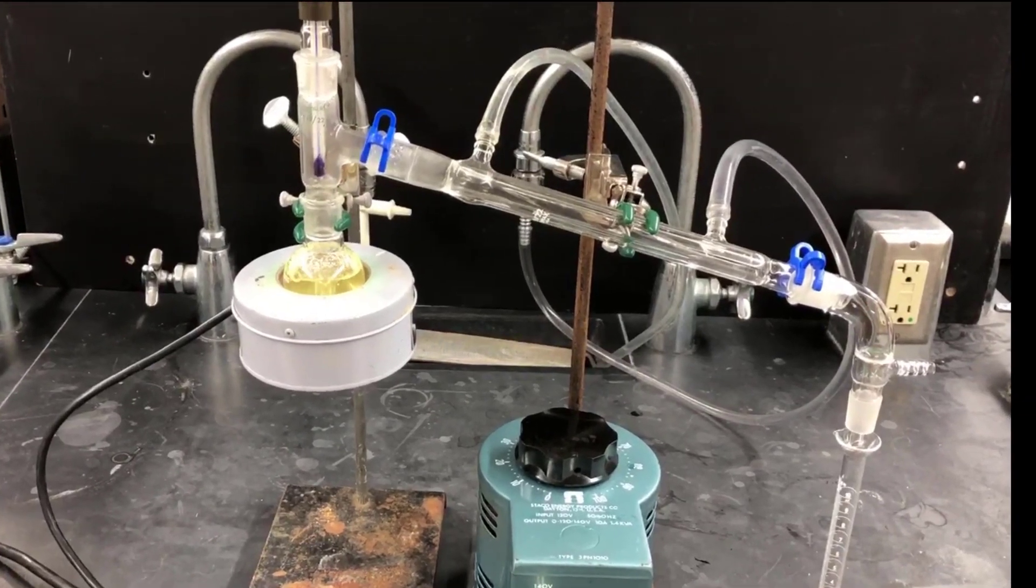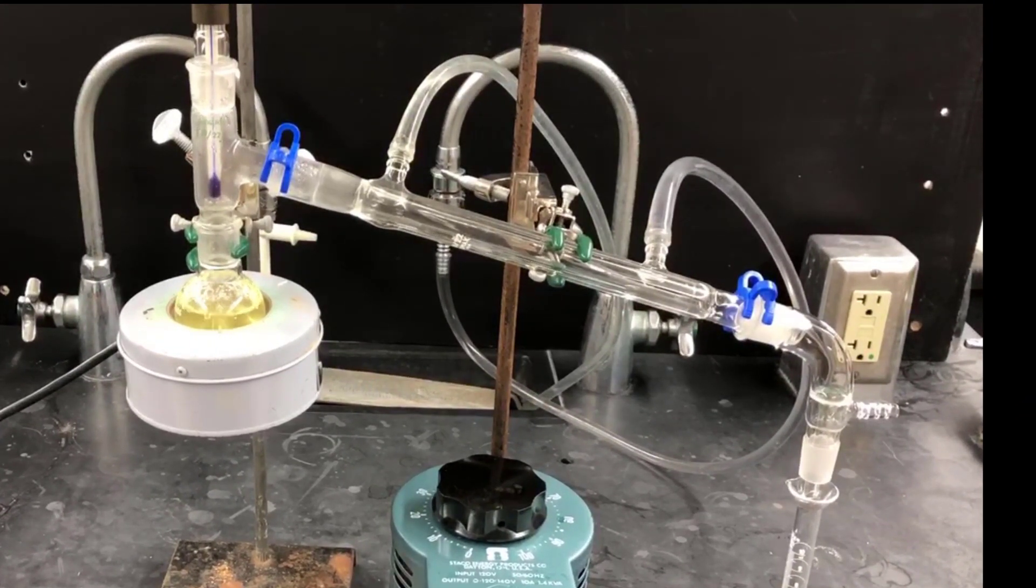Now some time has passed and the distillation is heated up, and we can see distillates starting to condense in the condenser and roll down into the collection vessel.